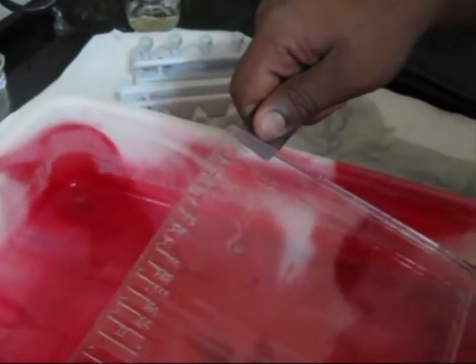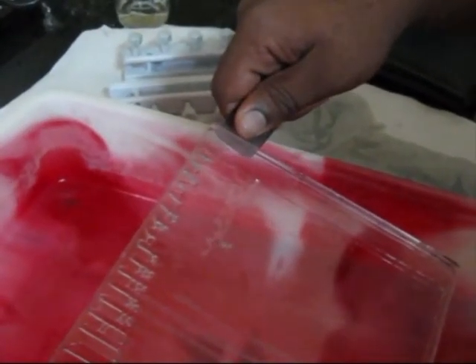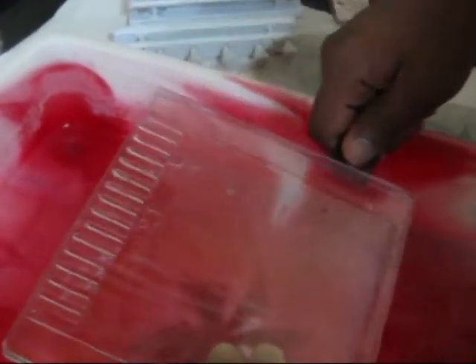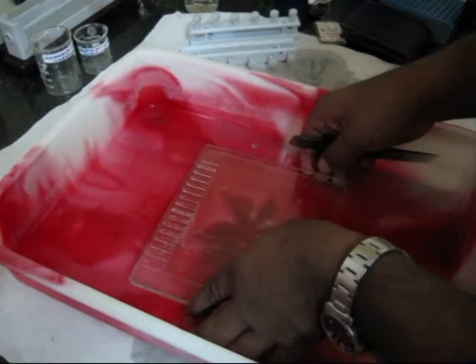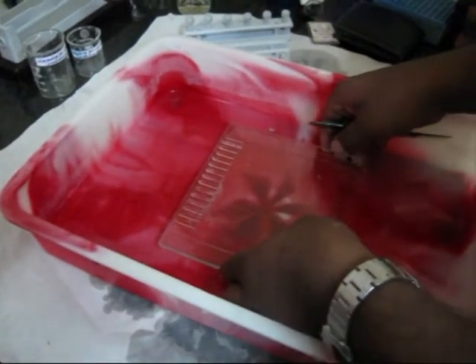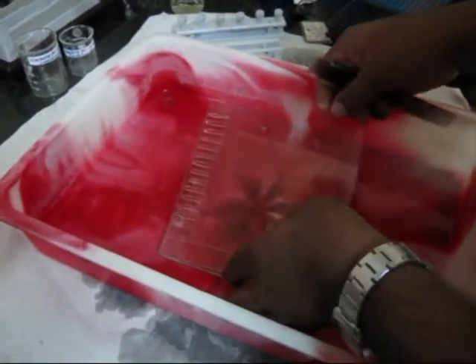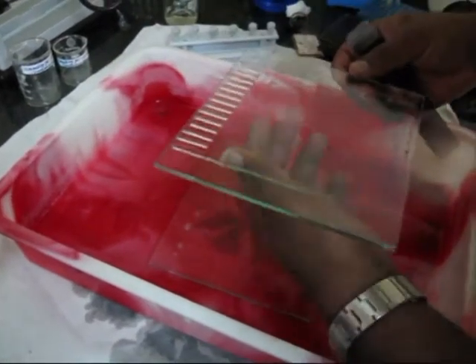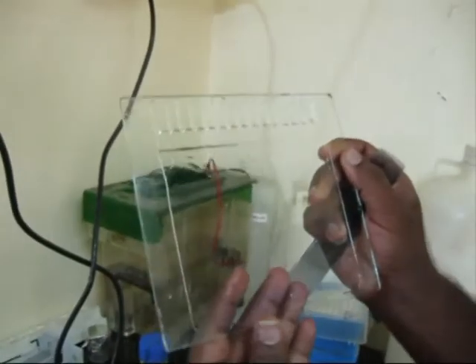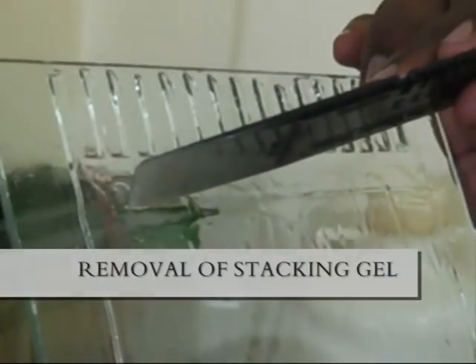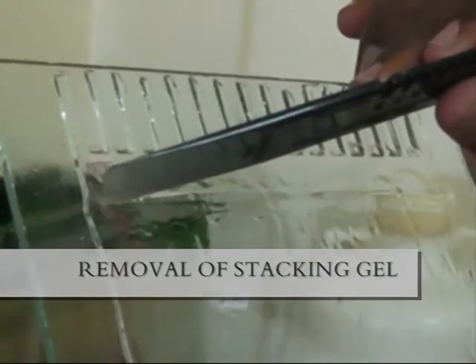Without much stress on the gel, the gel plates are separated. For convenient handling of the gel, the stacking gel is removed.